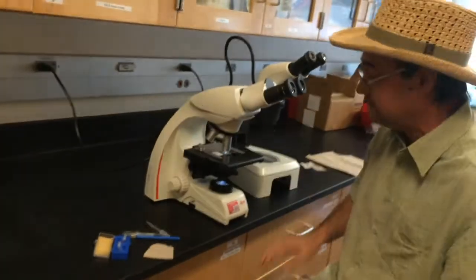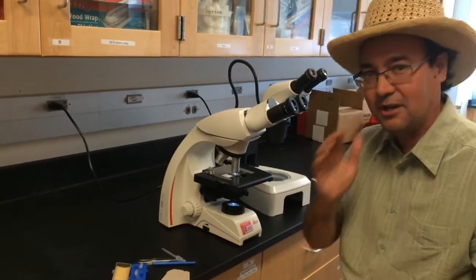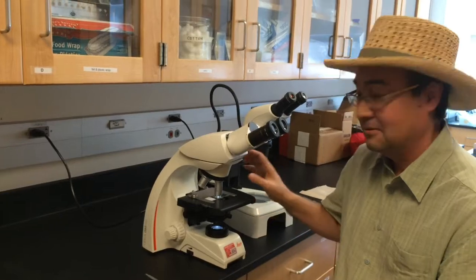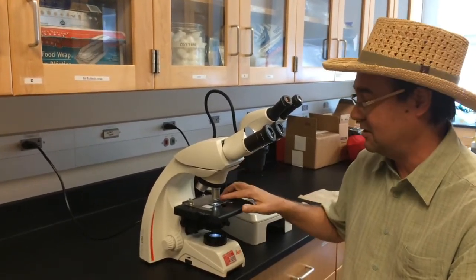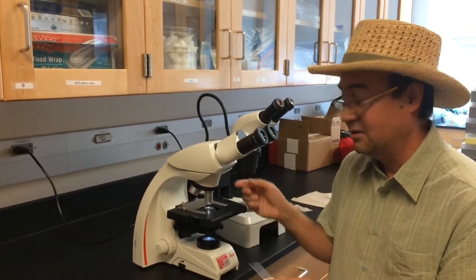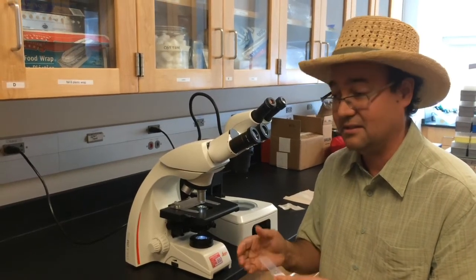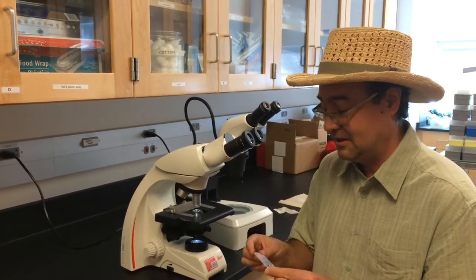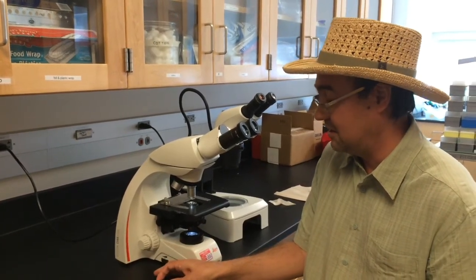Okay, so you do your thing, and then you're ready to change slides. And here's what I want you to do for me. Always rotate this back down to a shorter objective before you yank off the slide. That way we don't get goo on the high power objective, which means we don't have to clean it, and it doesn't get damaged, and it doesn't drive me crazy. And that's all I have to say about that.